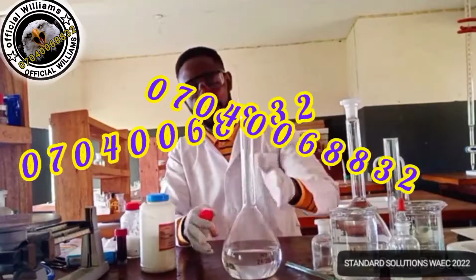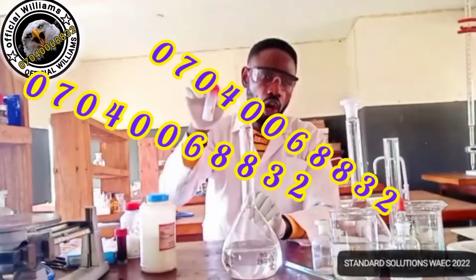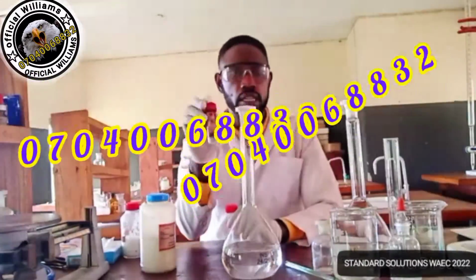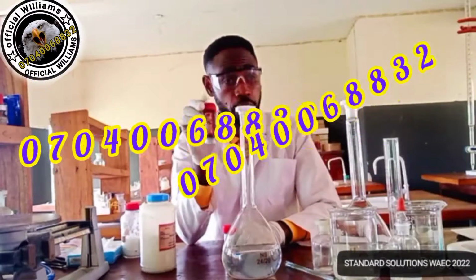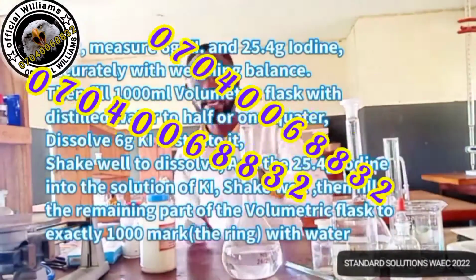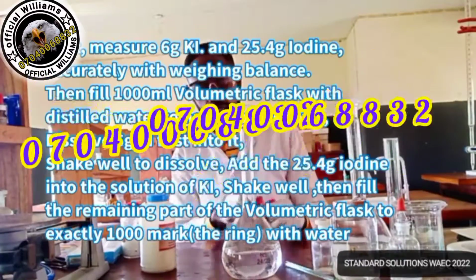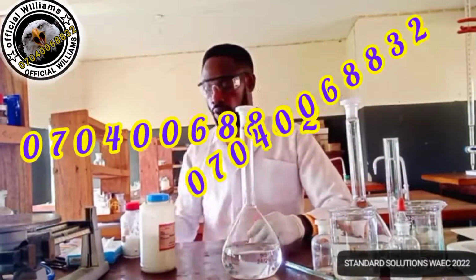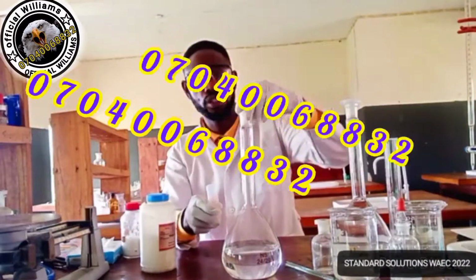So what do you do? Like I've added 500 cm3 of water here. What I'll do is I'll now dissolve these 6 grams of potassium iodide into it, followed by the mass specified, which I've measured already, 25.4 grams of iodine crystal. You add it into the already existing solution of potassium iodide. Don't make up to 1000 before adding all these things. Just add halfway, then add the two, and you now make it up to 1000. So first of all, I will have to make my potassium iodide solution.